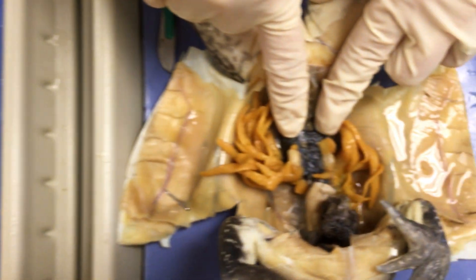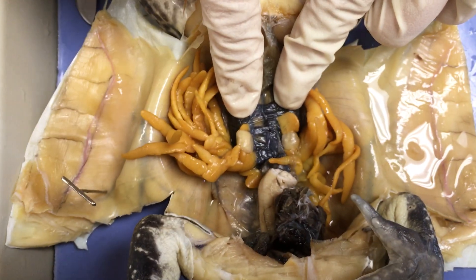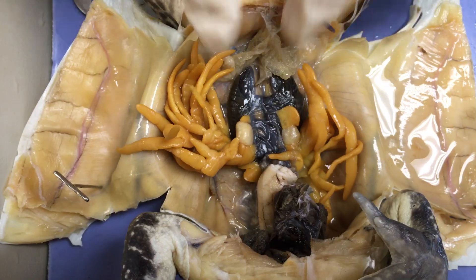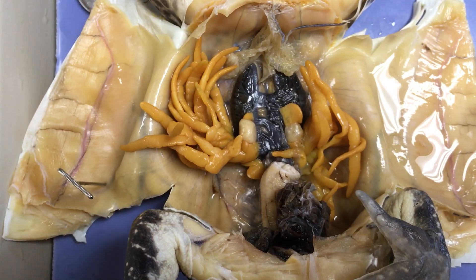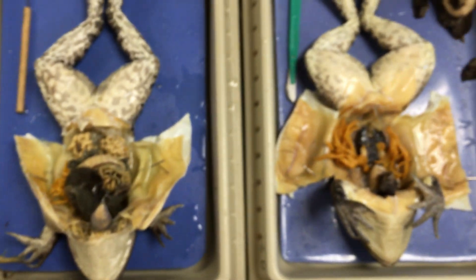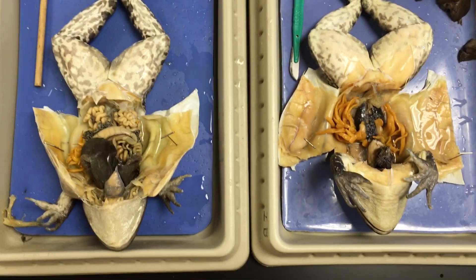Female with eggs and oviducts; male over here that we've determined because of the presence of testes. I think that covers everything for the internal anatomy.